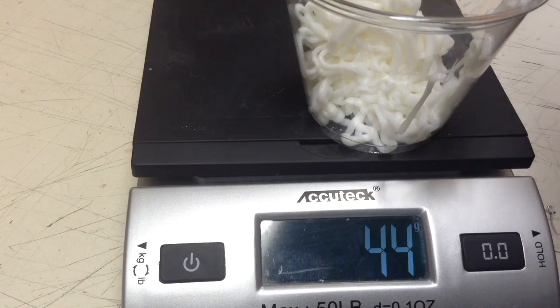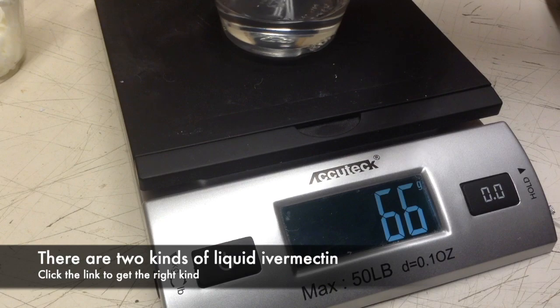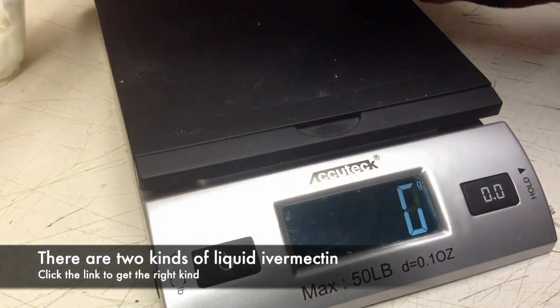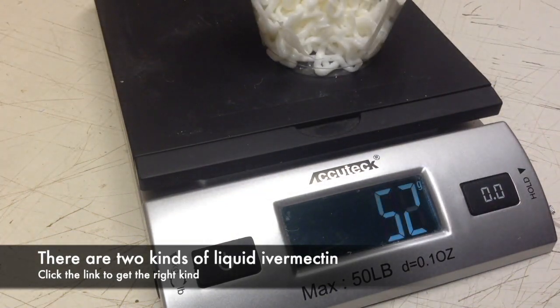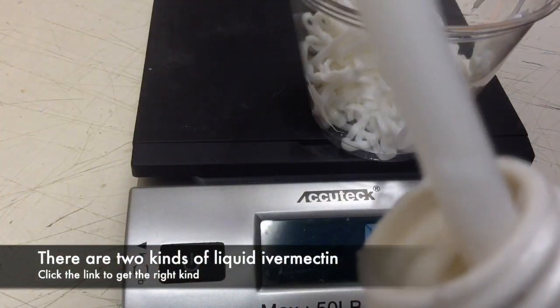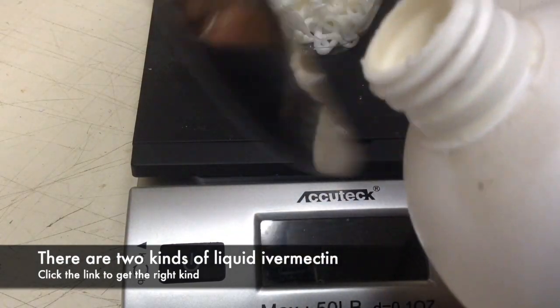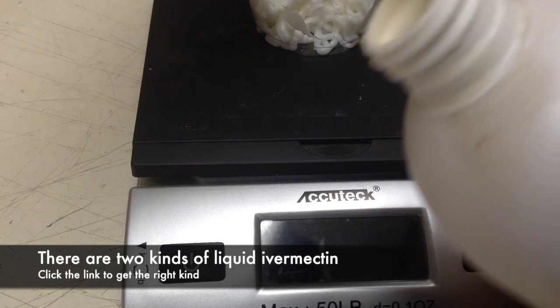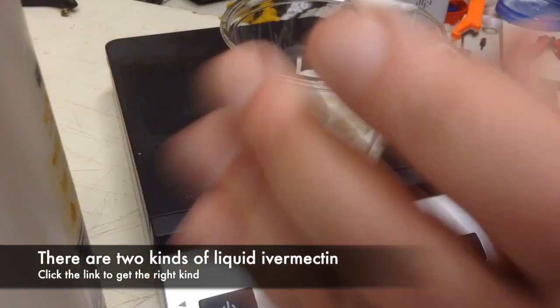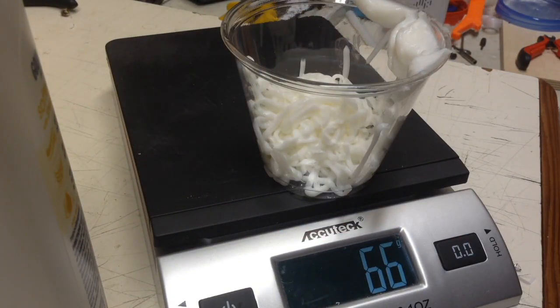Get in there. And that's 66. That's alright. They should both be 66 then. So now it's 60. I'm having trouble getting the last little bit out, so I'm taking off the cap. I'm going to just reach inside here with a butter knife. It's reading 66 now. Good for me.